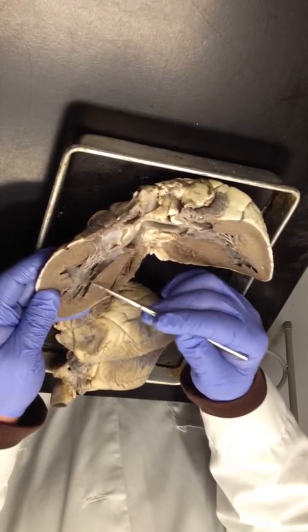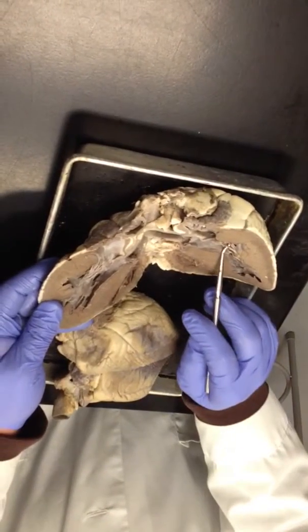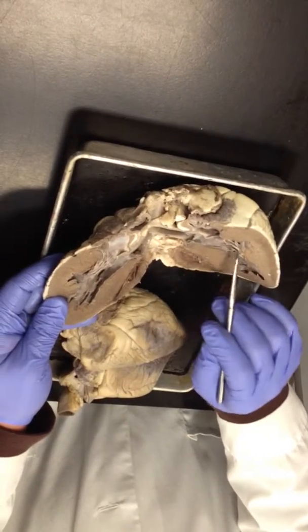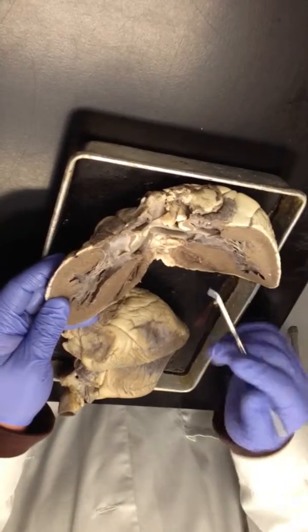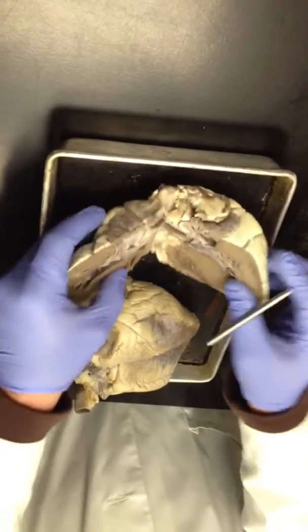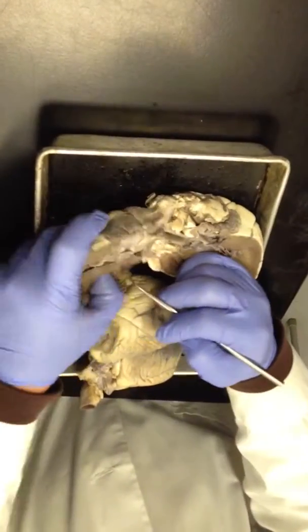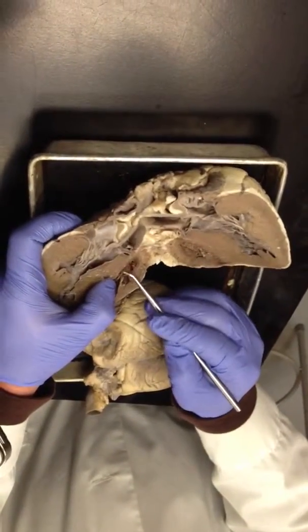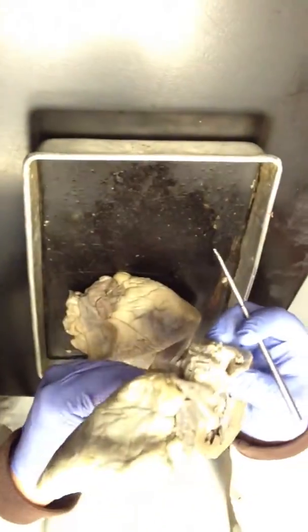Here you can see a big one there, left ventricle. Here's some more cords for the other part of the bicuspid valve on this side, and they insert into a papillary muscle over here. The AV valve on the right side of the heart. Let's see if I can see this one. I can barely see it. Those little pieces of it right here, those little cords, that's part of the AV valve. I guess most of it is over here.